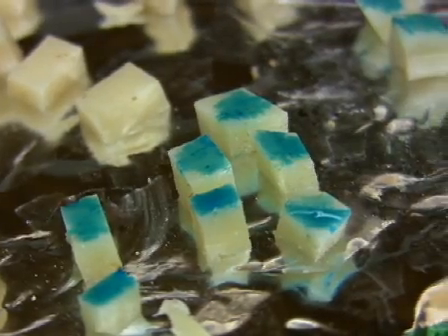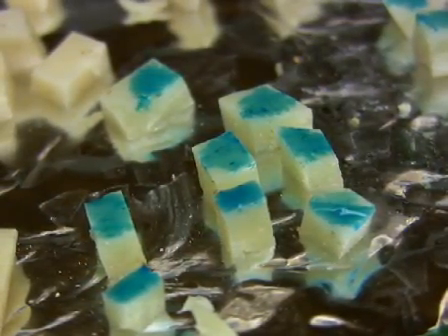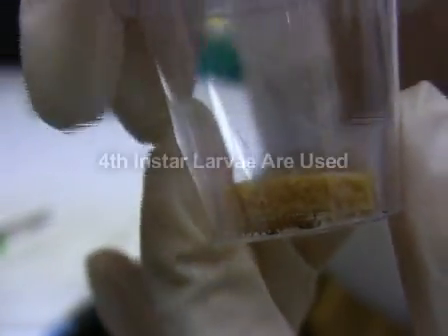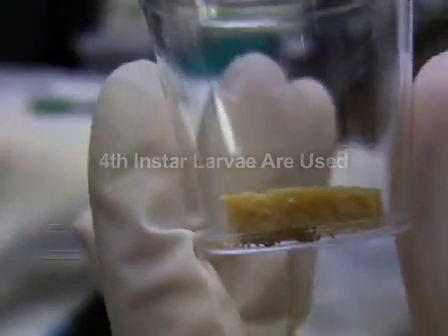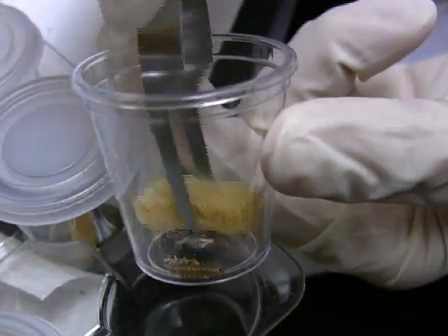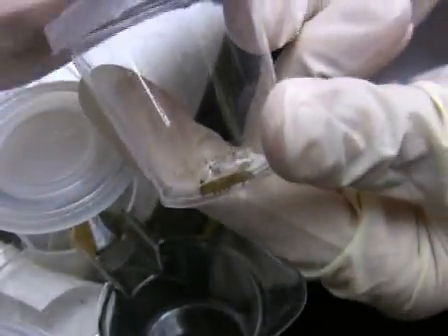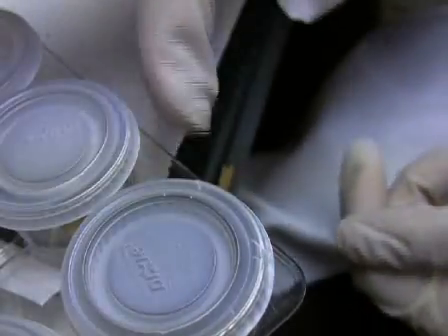Now that Huang has shown you the droplet feeding bioassay, I'll show you the diet plug bioassay. In the diet plug bioassay, mid to late instar larvae are fed on a diet plug treated with a known dose of virus to determine the lethal dose, or LD50. On the day prior to conducting this assay, remove the diet from the cup to starve larvae overnight. This step will increase the speed with which the larvae consume the virus-inoculated diet cube.